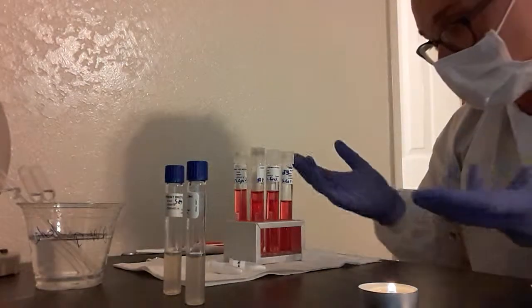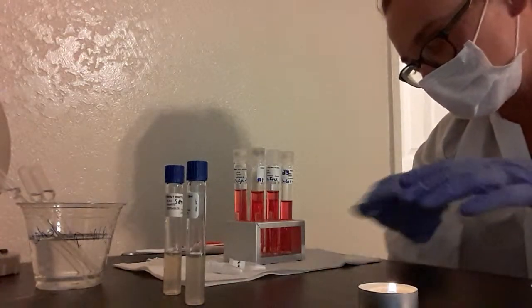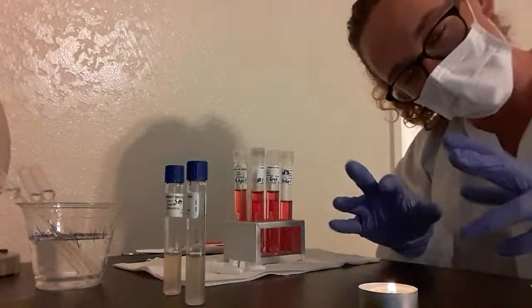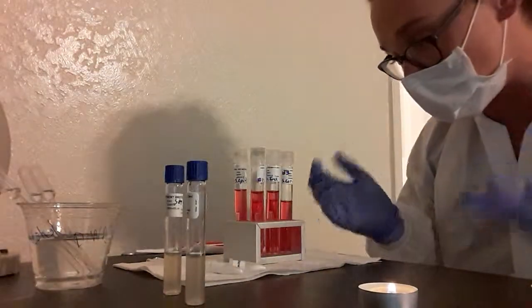And like I said, this is a pretty cool test. I could see them running it to help break it down into different specific groups. But I would almost imagine if you're looking for something else, you would have to run another test on top of this test. All in all, pretty cool experiment.